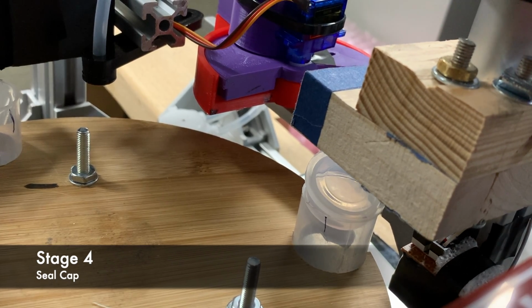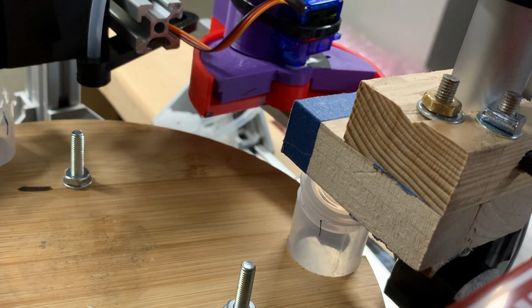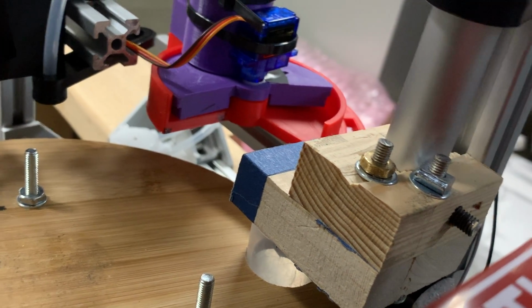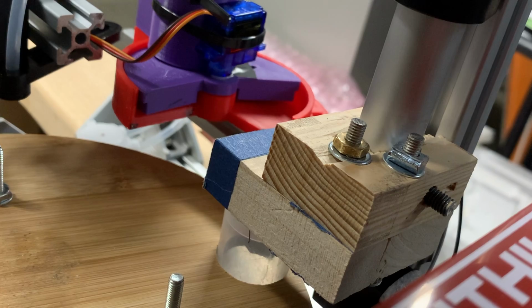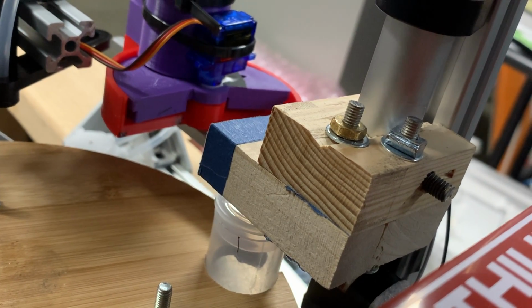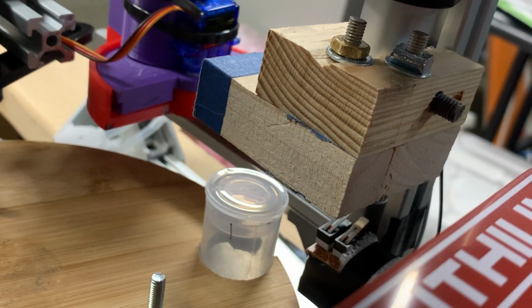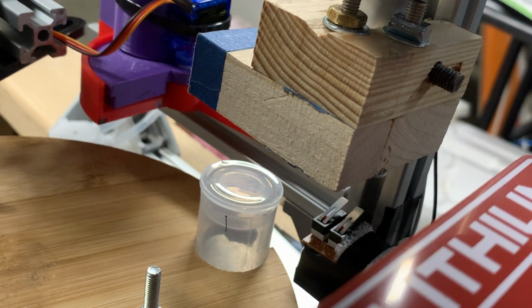It is run on a 12-volt 2-inch stroke linear actuator motor and uses 2 micro limit switches to ensure the extension does not go beyond the necessary stroke. Once the current sample tube has reached this final stage, the next sample tube will be lined up and ready to begin a new cycle. This continues for a total of 3 samples.